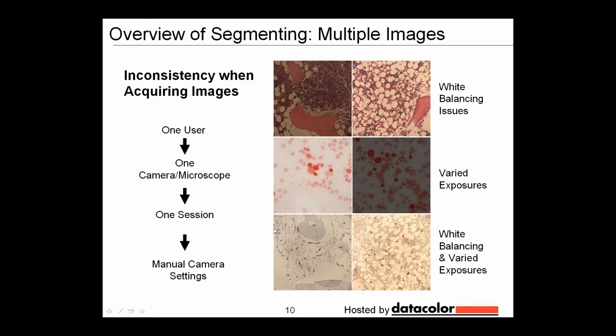But in the real world, what you find out is that when you take these images, there's a fair amount of variability from microscope session to microscope session, and sometimes within a single session. This is kind of an egregious example, but you can see that there's a fair amount of variability taking images. The person who took this image was unfamiliar with the camera, and the major problems have to do with white balancing issues. The background here should be a neutral white, and with varied exposures. And as you can imagine, this is just one user on one camera microscope, and this is just one session using manual camera settings, but imagine what it would be like if you had more than one user, more than one microscope, and more than one session.